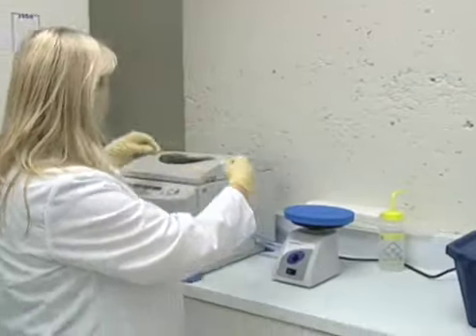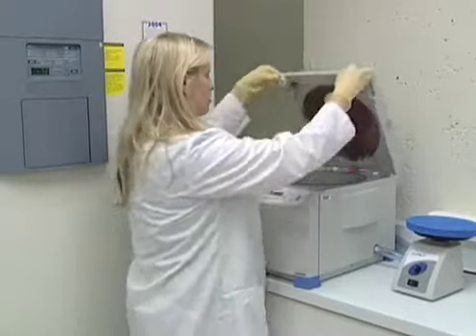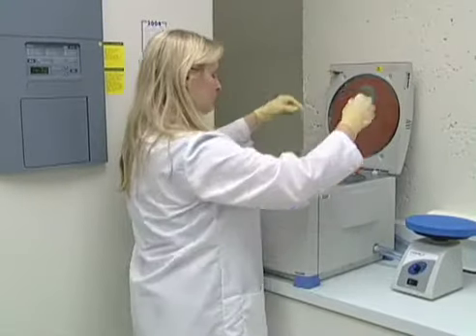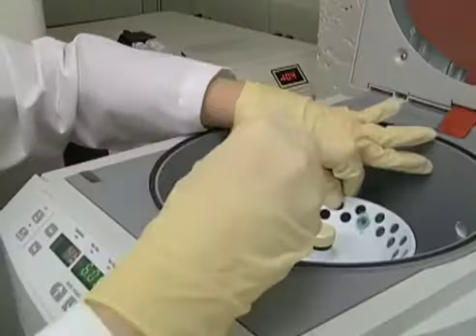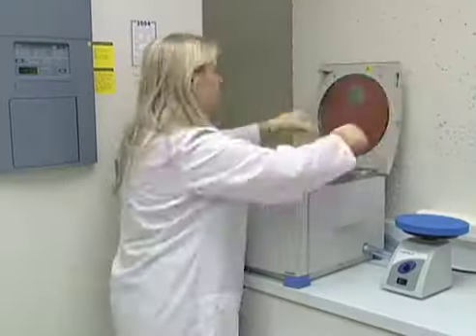Then we clean up the proteins by putting them in the centrifuge attached to a vacuum that will evaporate all of the water and salts in the mixture.